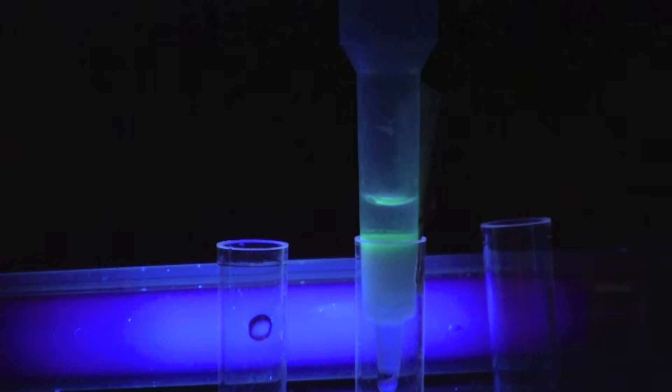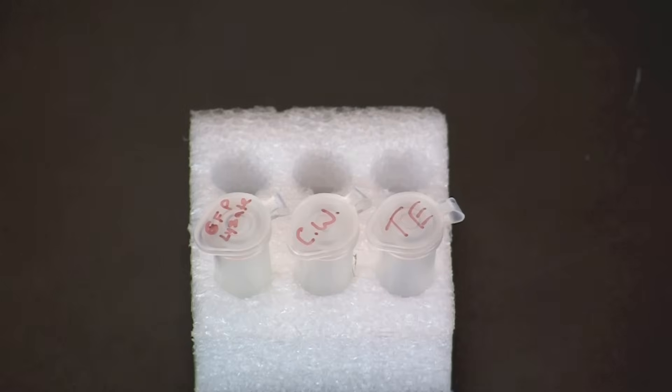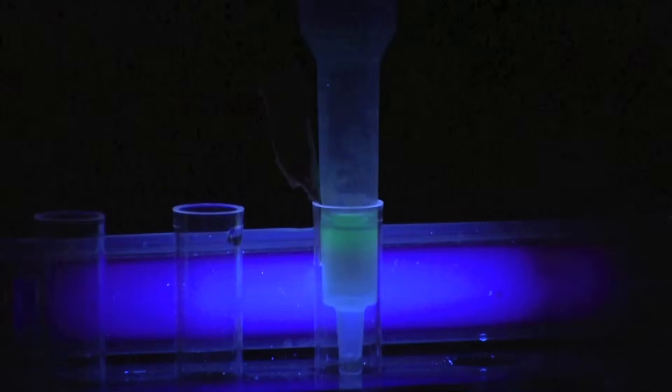Transfer the column to collection tube number three. Add 750 microliters of TE buffer. TE buffer contains no salt.